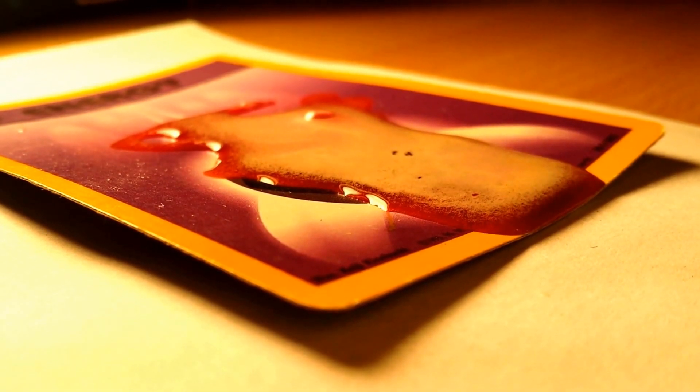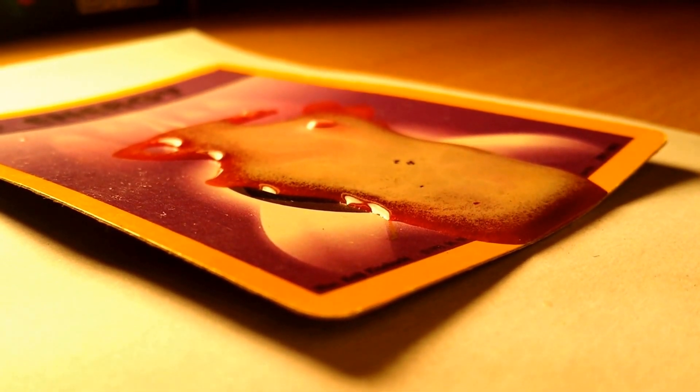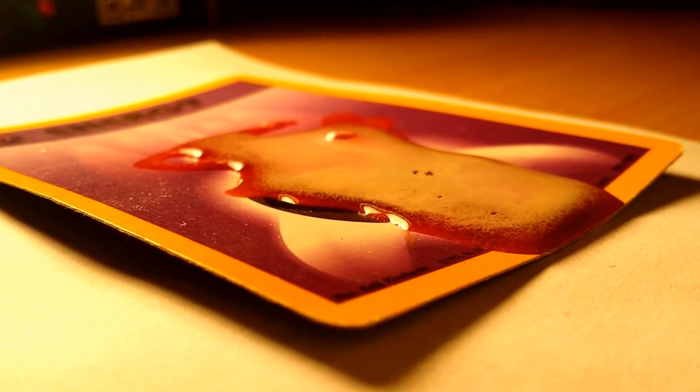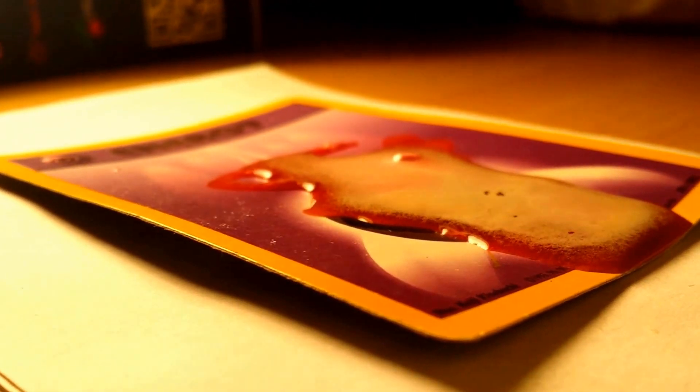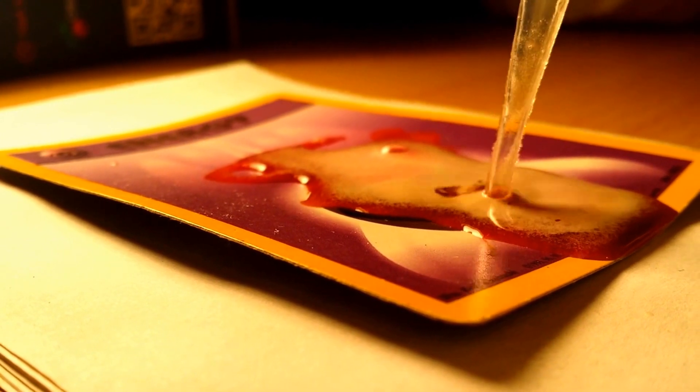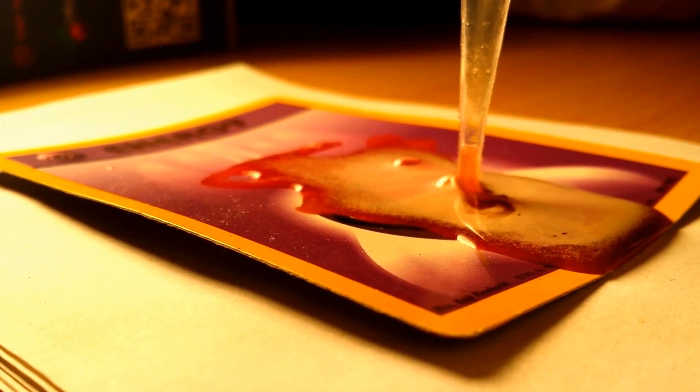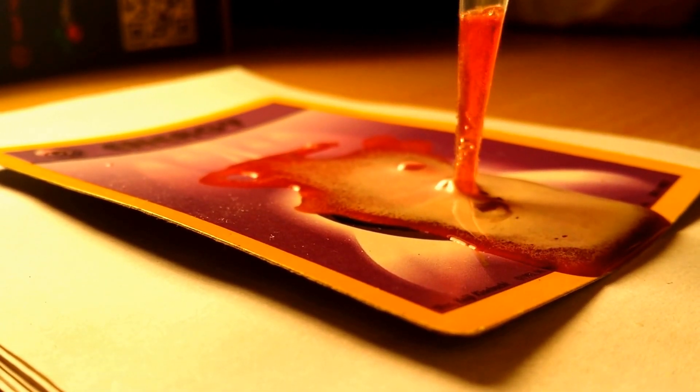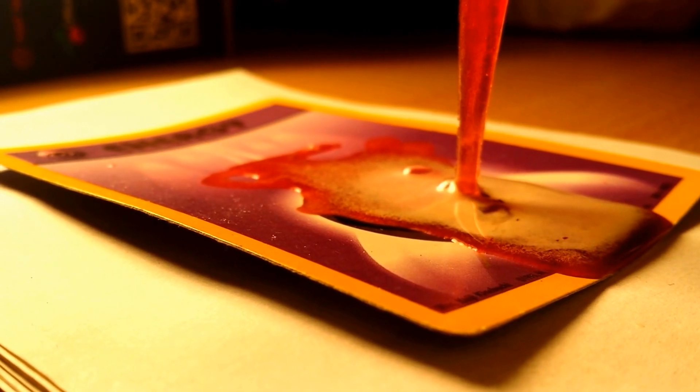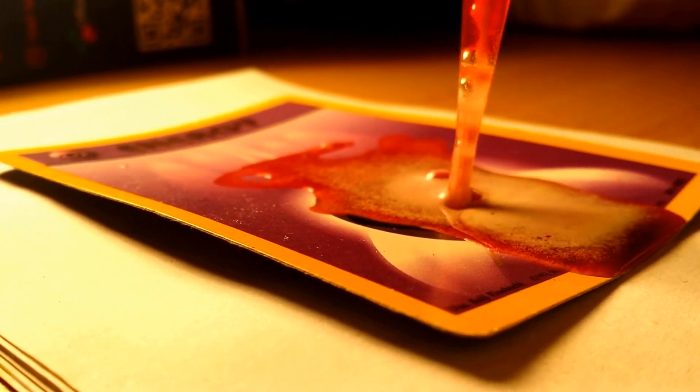Alright. Oh, some more bubbles. I guess we're gonna suck some of this up. We're sucking some of this up. Let's squirt it back out. Wait, give me a second.